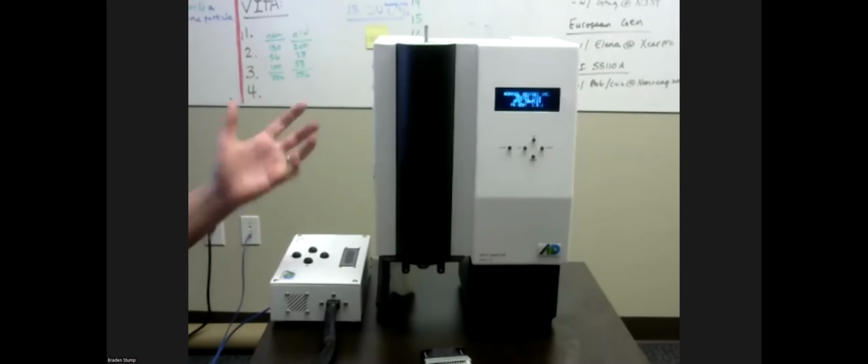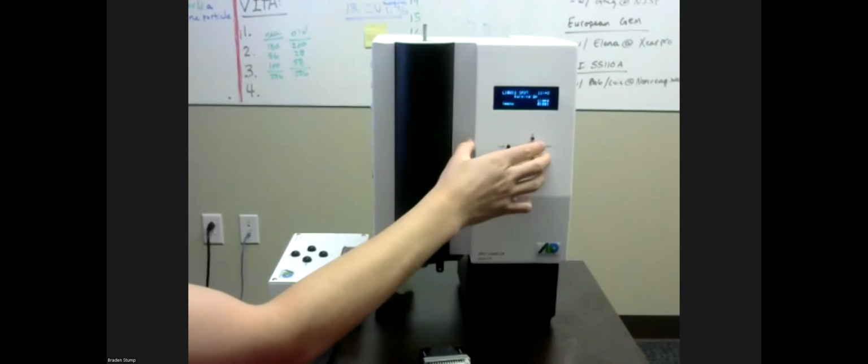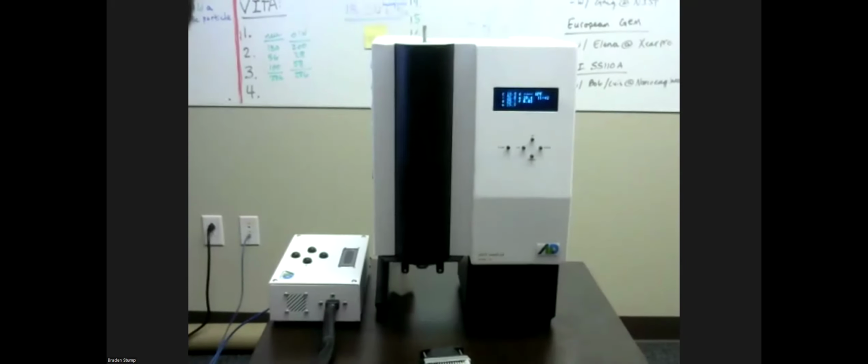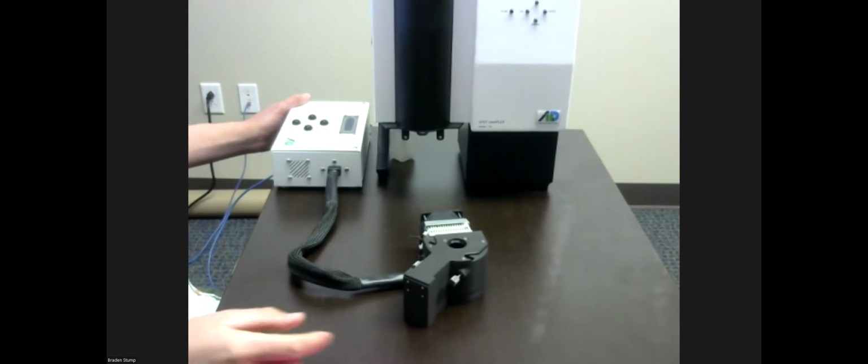So we're going to turn our spot sampler on first. Turning your sampler on first is pretty critical in this process, making sure that it gets to temperature, all that. Wick is already wet. I'm going to go ahead and start this sample because we aren't looking for experimental integrity here. We're just kind of looking to show off how things work.